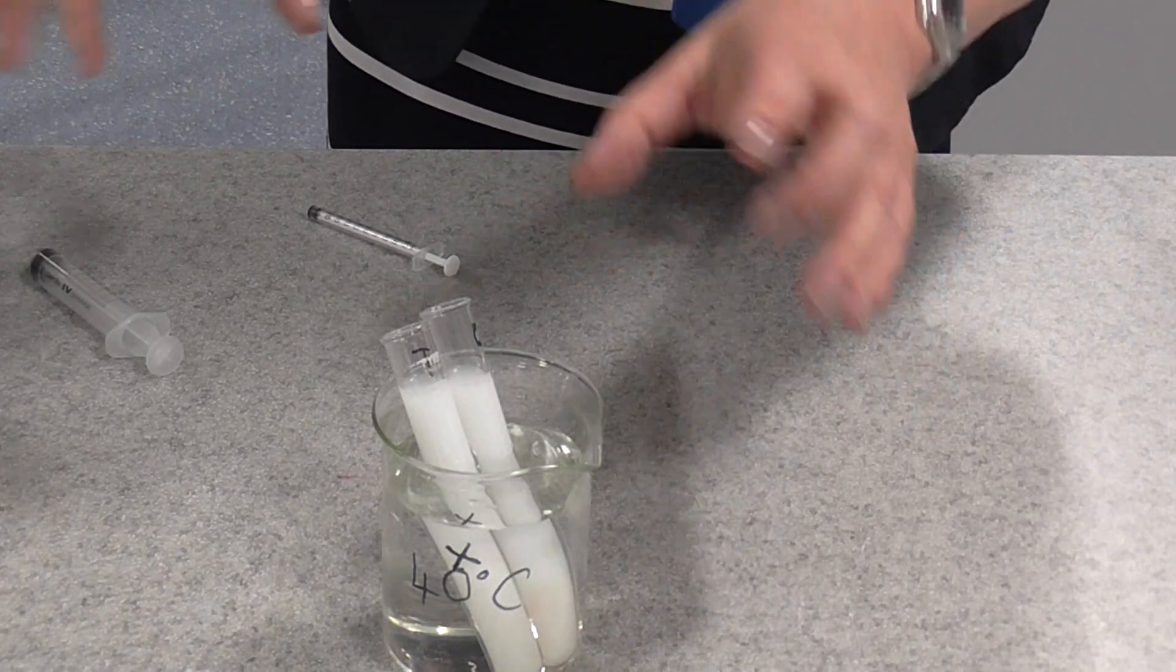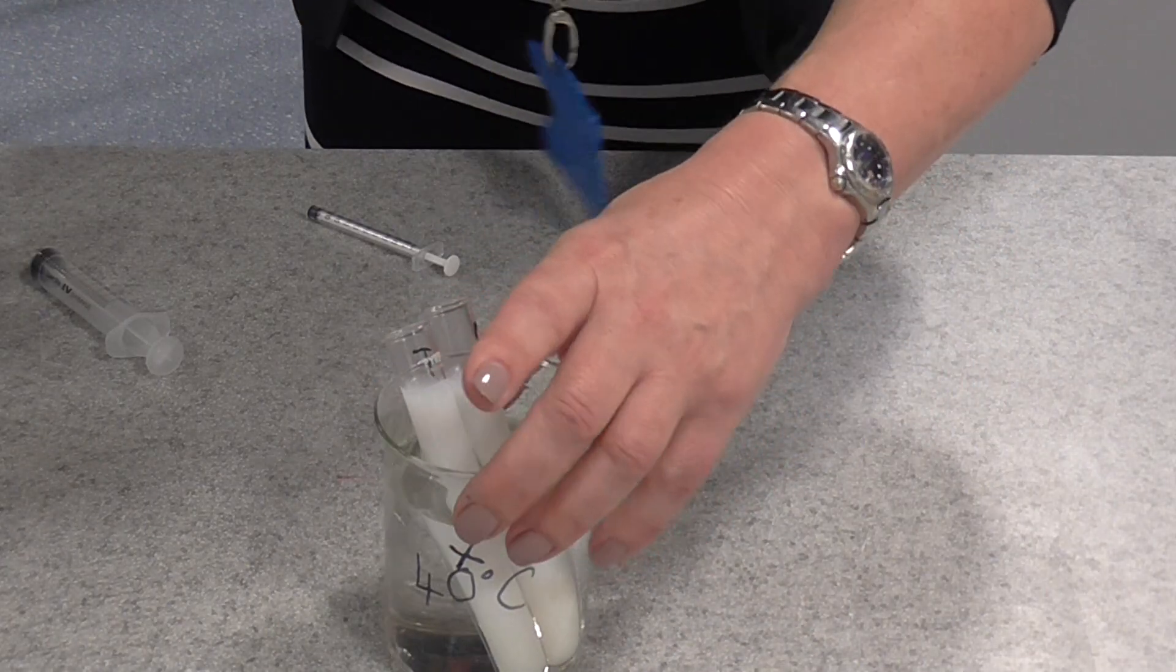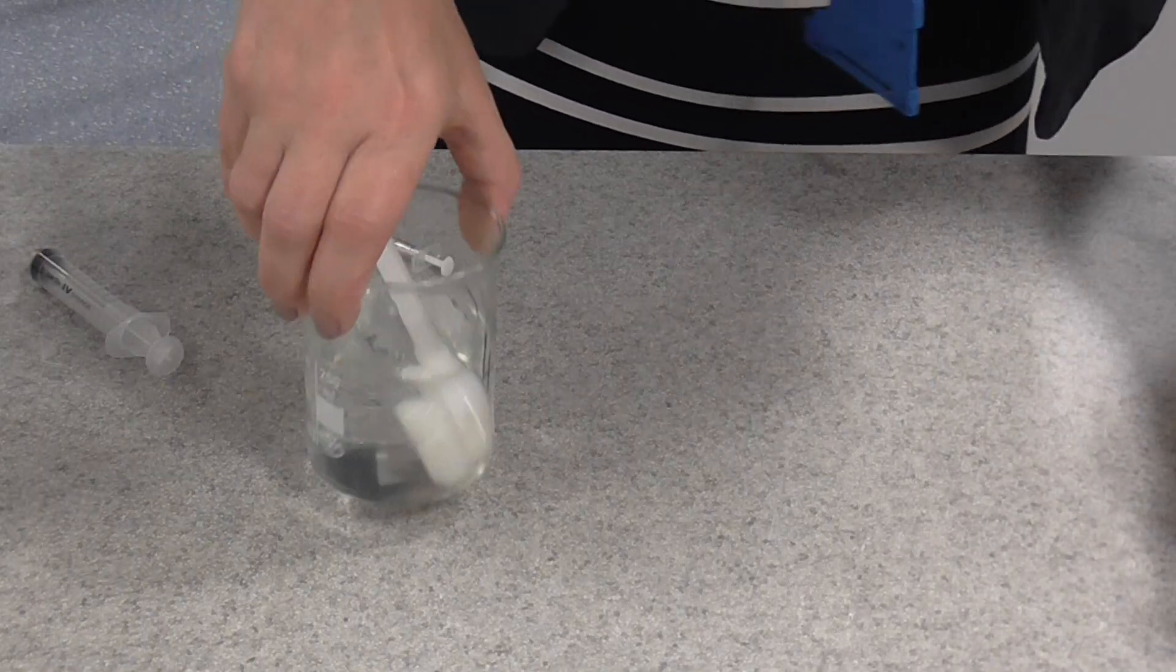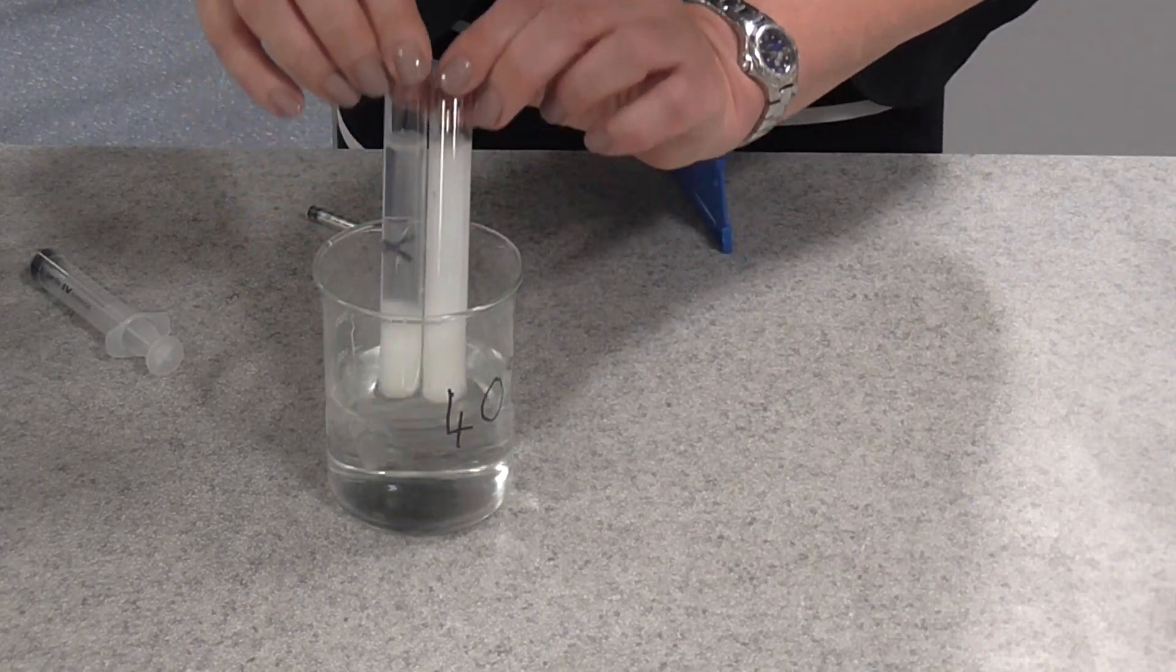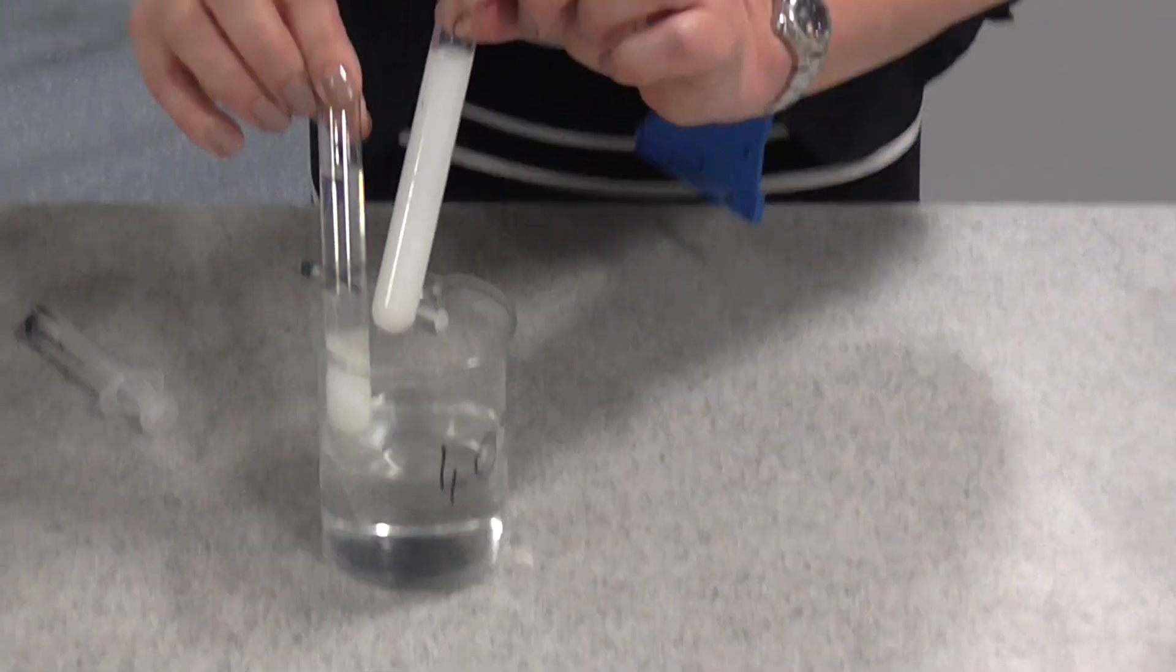I've already done this and I've actually timed, and what you're doing here, you're actually timing until you can actually see, and you can see the difference there, that's the control with no enzyme.